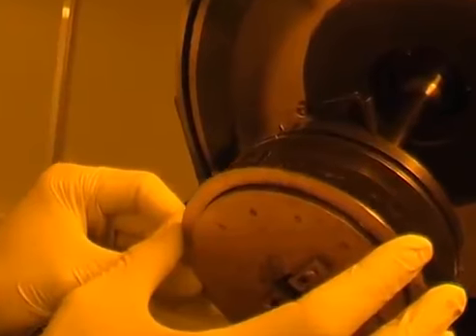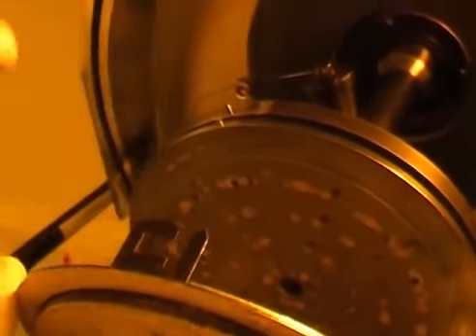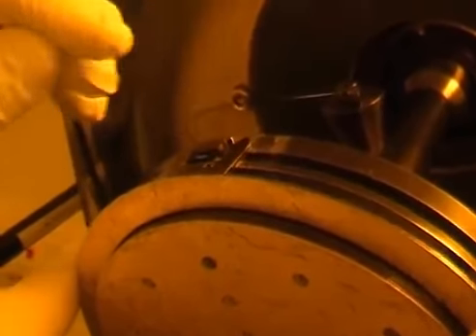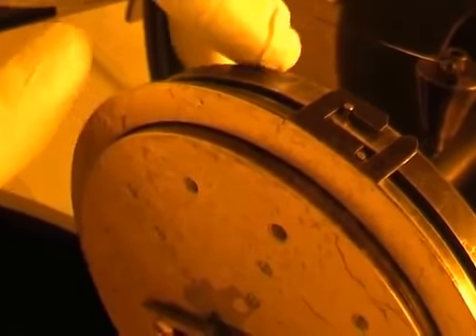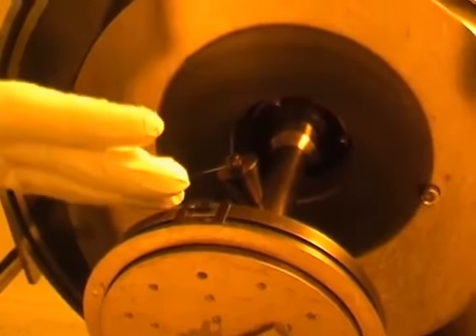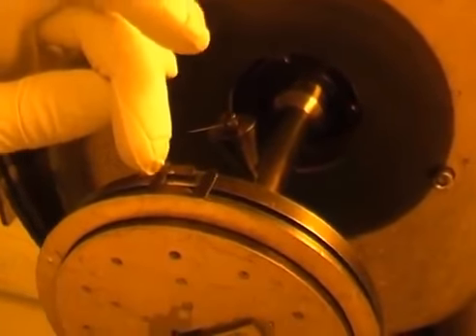and load the sample. I need to make sure that this part of the holder here is inserted where there are the two notches on the two wafer discs. Once I insert it, I need to turn the sample holder slightly clockwise. If everything has gone well, the notch in the second disc, the one that is behind, will be hooked to the sample holder, and so the sample holder will be in place and it won't fall.